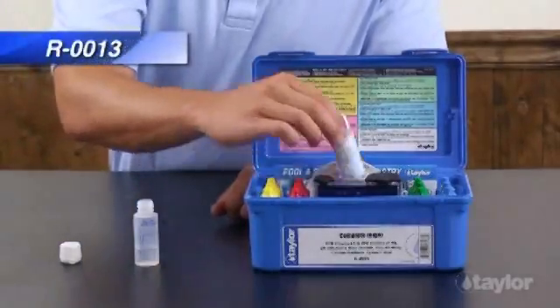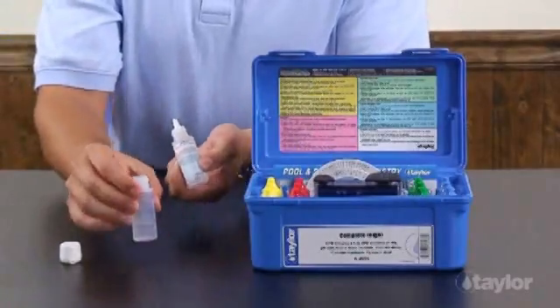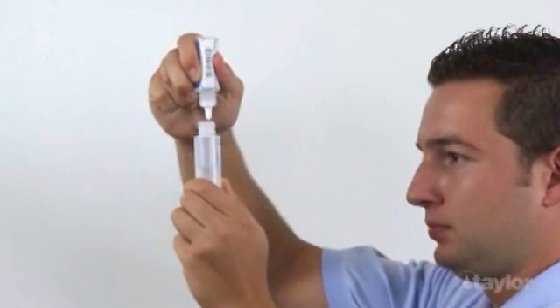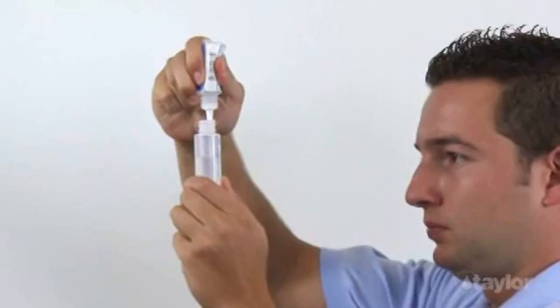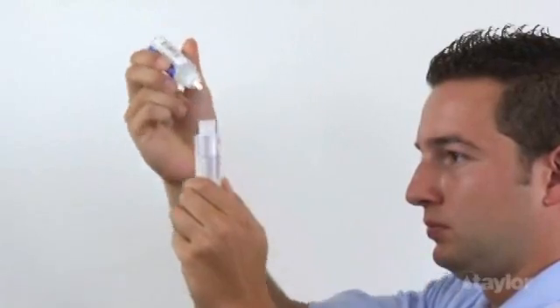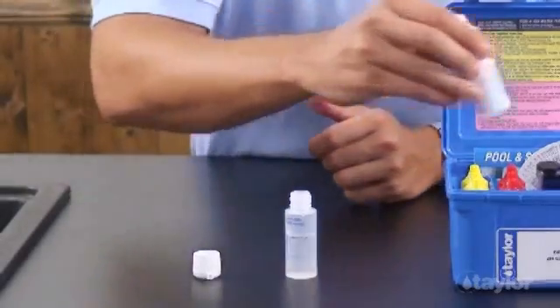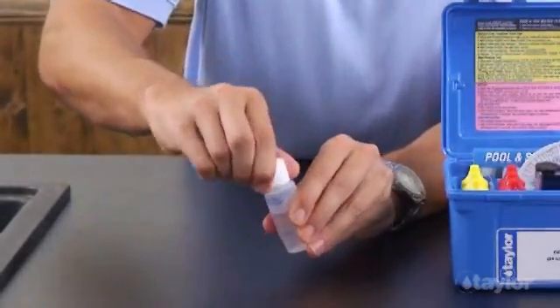Add reagent 13 to the 14ml mark. Cap and mix for 30 seconds.